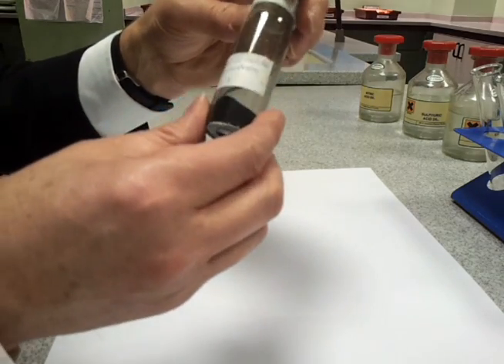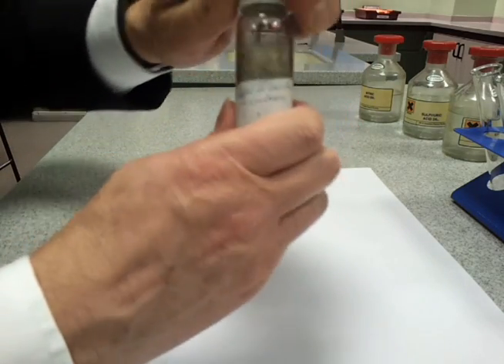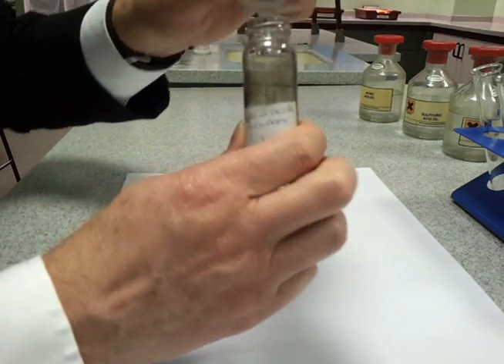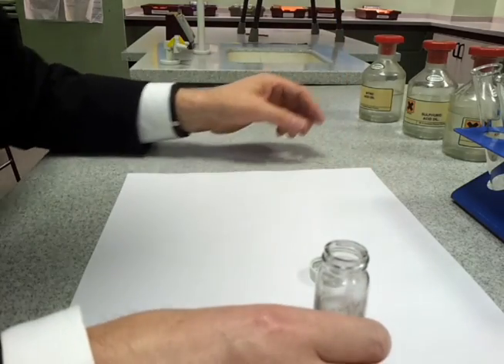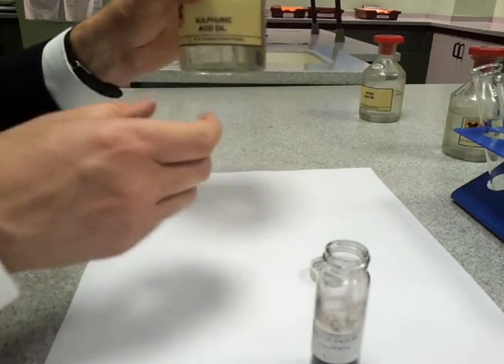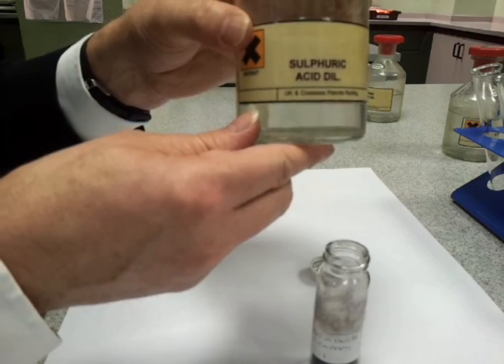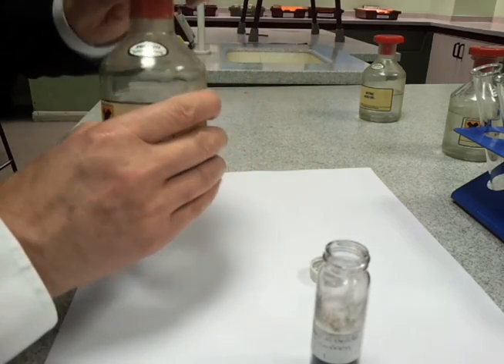In this reaction, my reactants are going to be black copper oxide powder and sulfuric acid, which is a clear, colorless liquid.